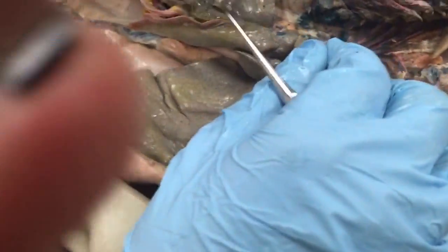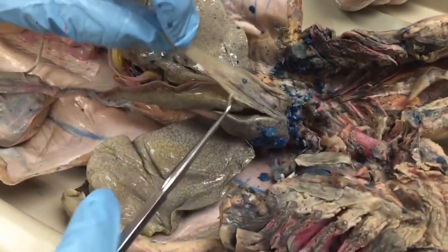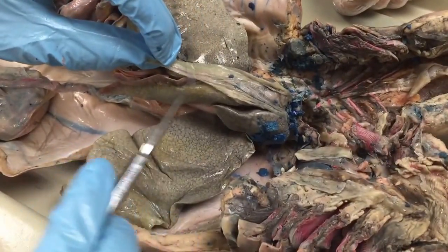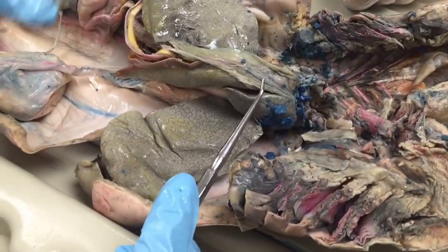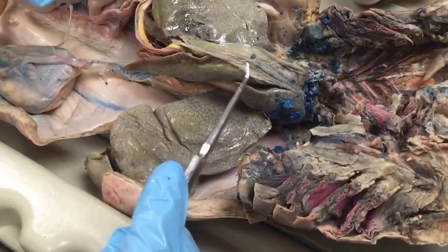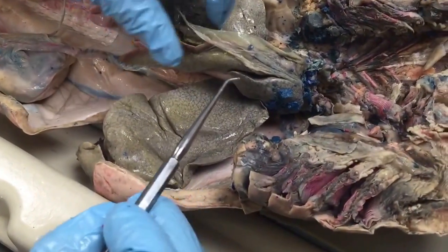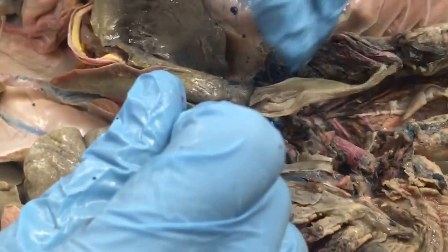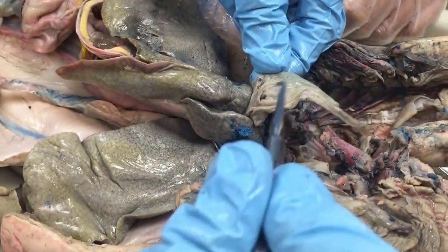Everyone remember that from digestive respiratory? The falciform ligament here is typically much larger in mature females. If you were to look at a juvenile female, the falciform ligament would be about the same size. But in mature females, it's larger and you have this opening here that forms.